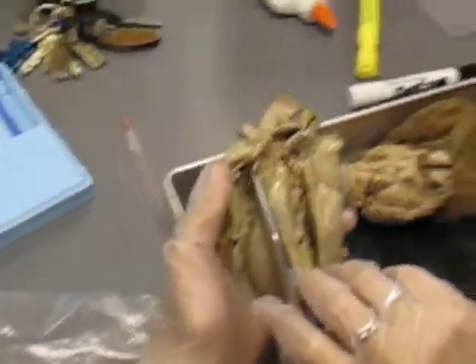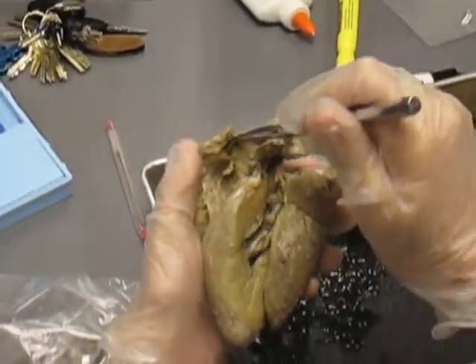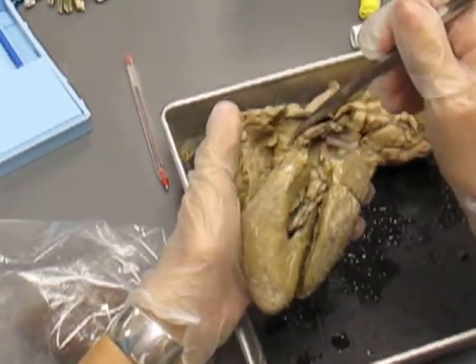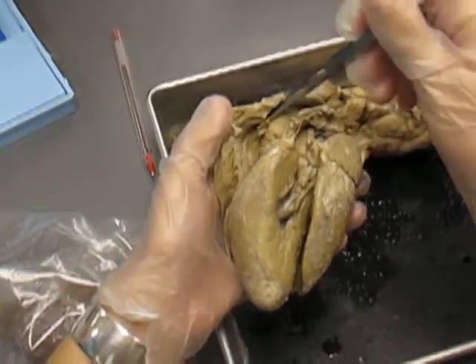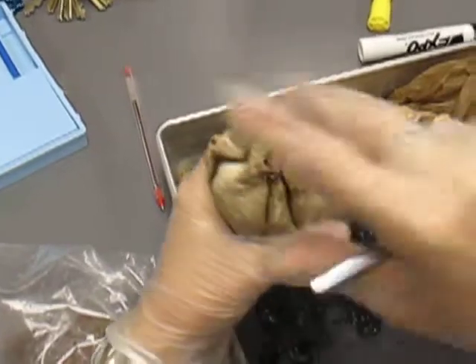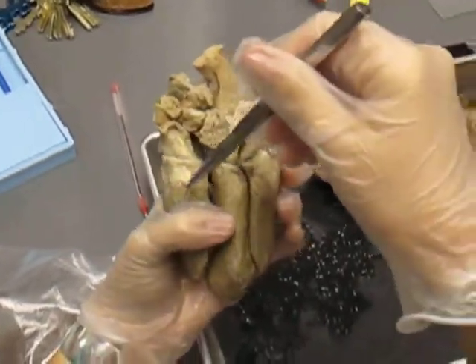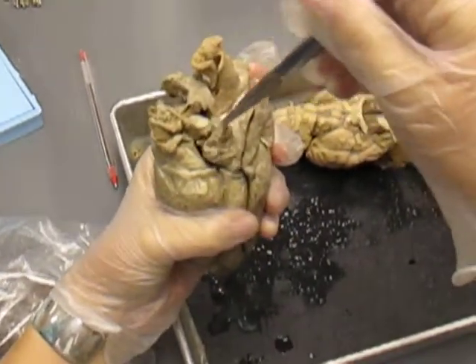So blood exits through the pulmonary trunk into the pulmonary arteries. You have the semilunar valve there, and one that was supposed to be there, not there anymore. But you have a nice one right there. So that's a pulmonary semilunar valve. And then blood goes to the lungs, gets oxygenated, comes back, enters the left atrium via 4 pulmonary veins.